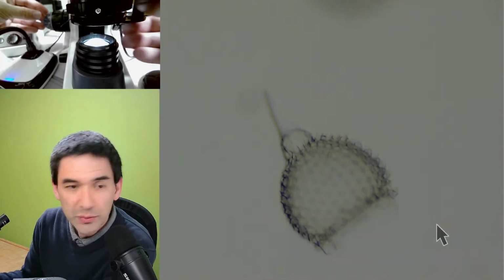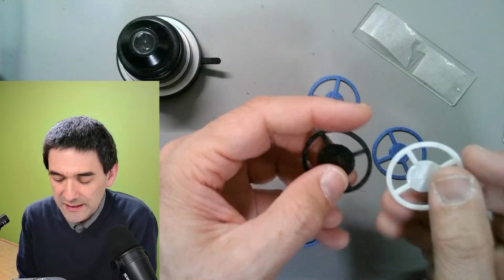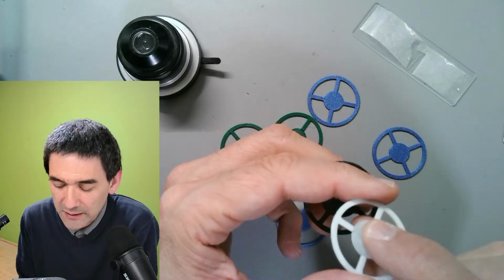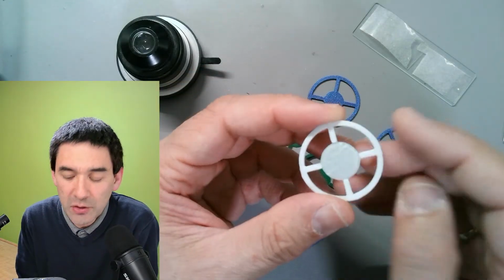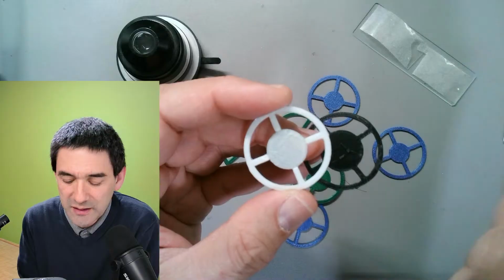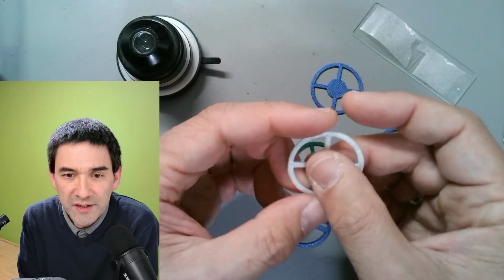So what I want to do now is show you another filter here. What I've been experimenting with, where is this? The desk view here. It is this one over here, which I printed with a white filament, and I made the central patch stop disc very thin. Why? Because I wanted to reduce the contrast a little bit. I found that if you completely block out the light, the contrast is very extreme. So I experimented with different colors and trying to give it a slightly different background color. All of this is possible.